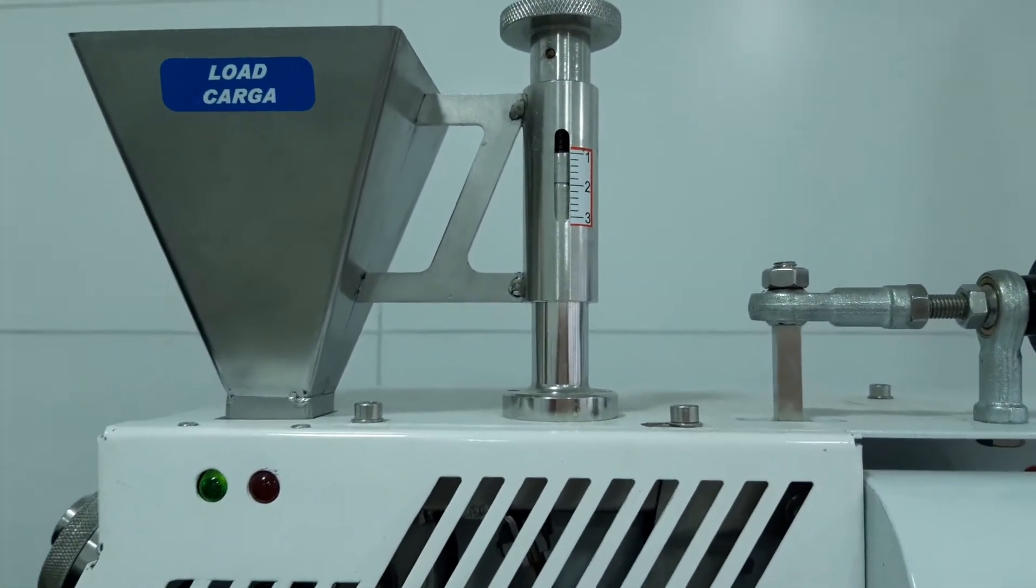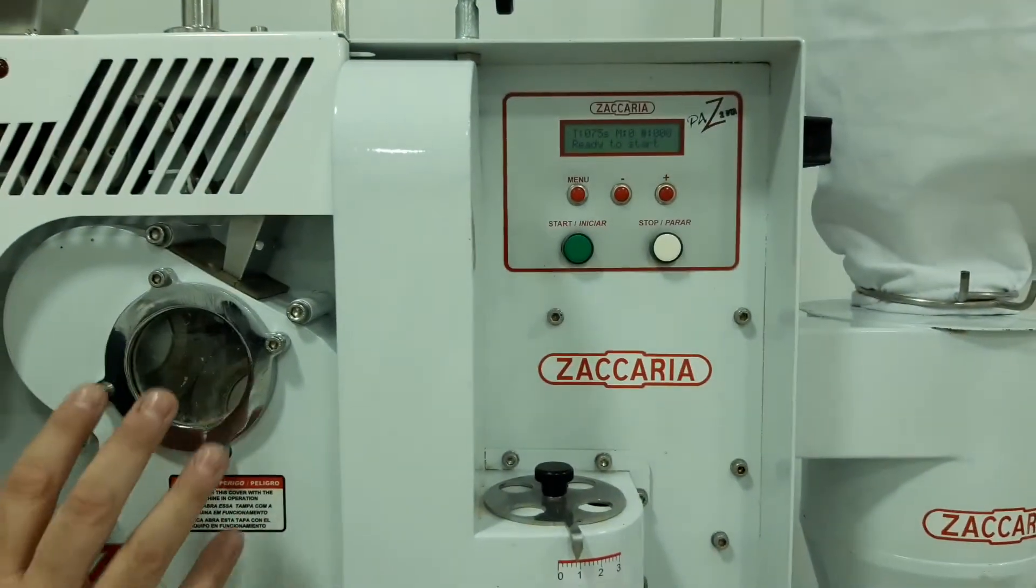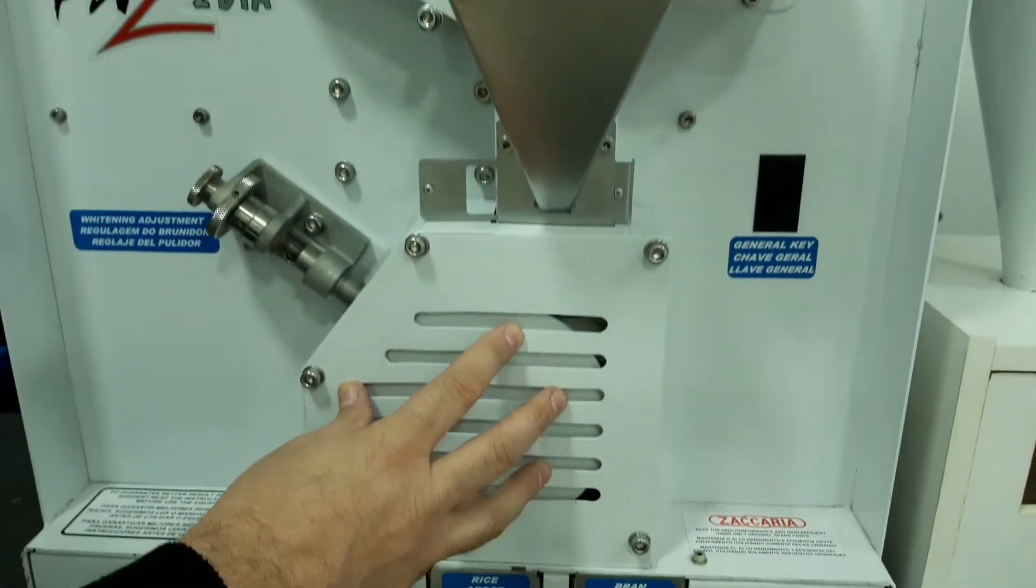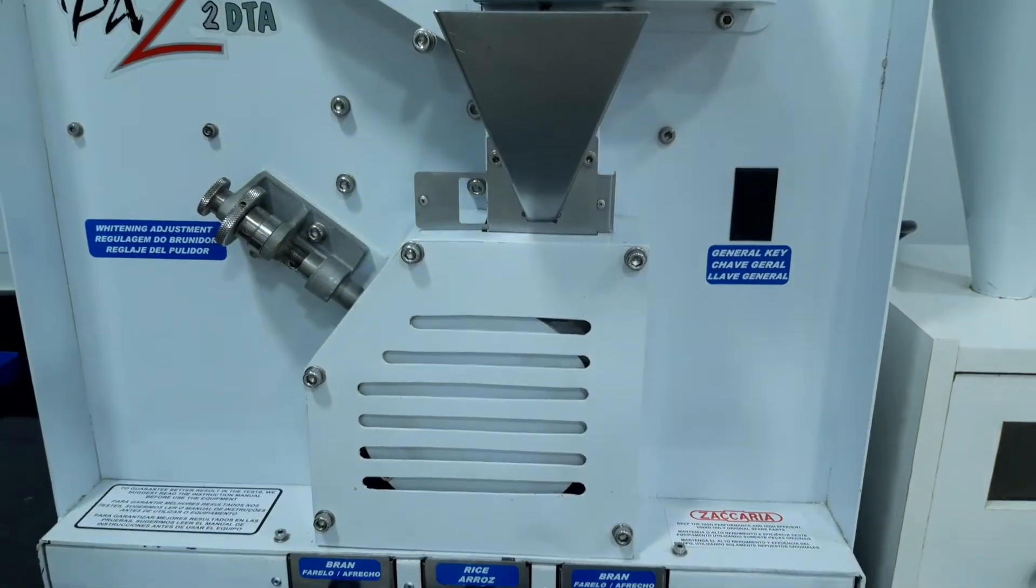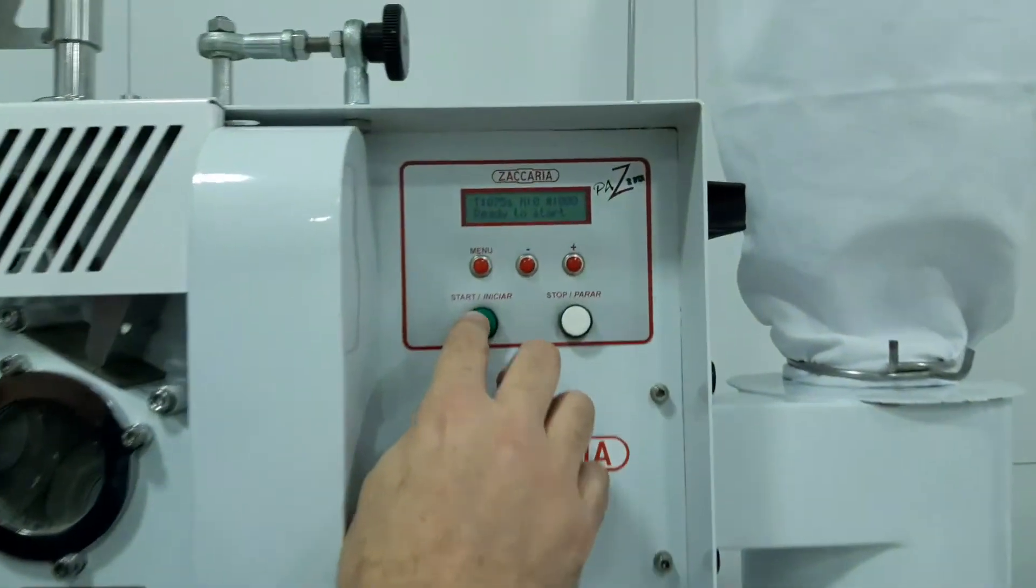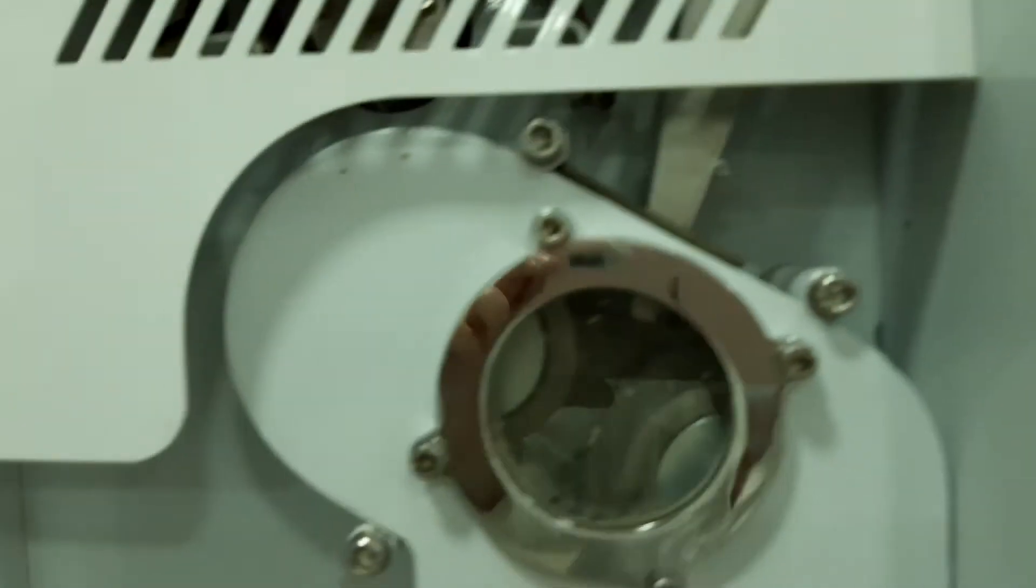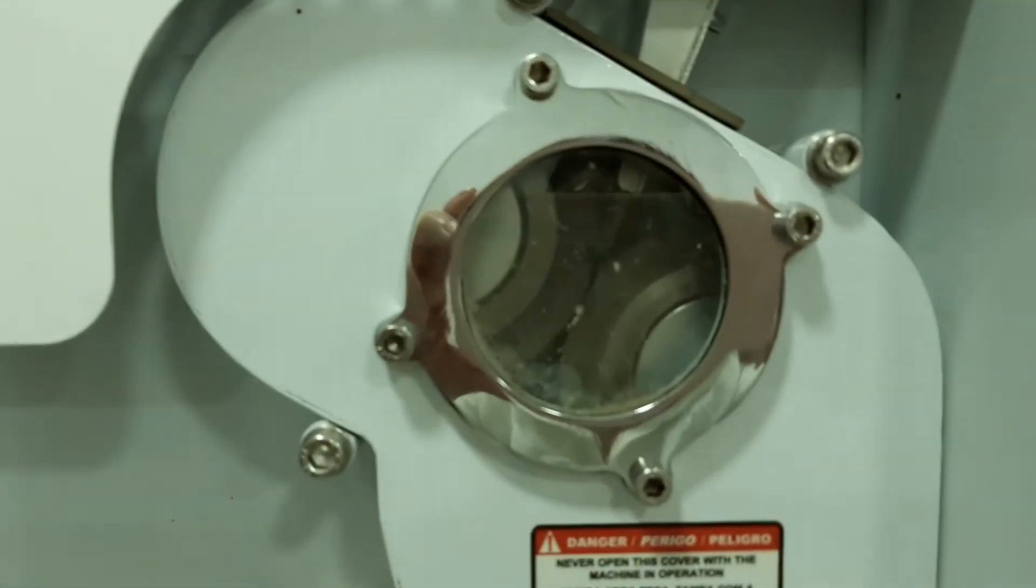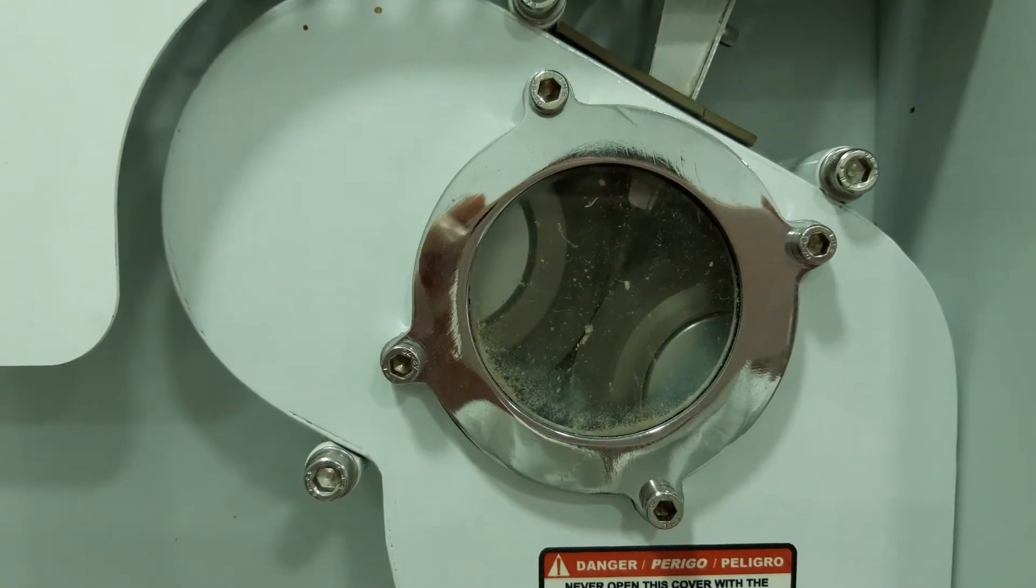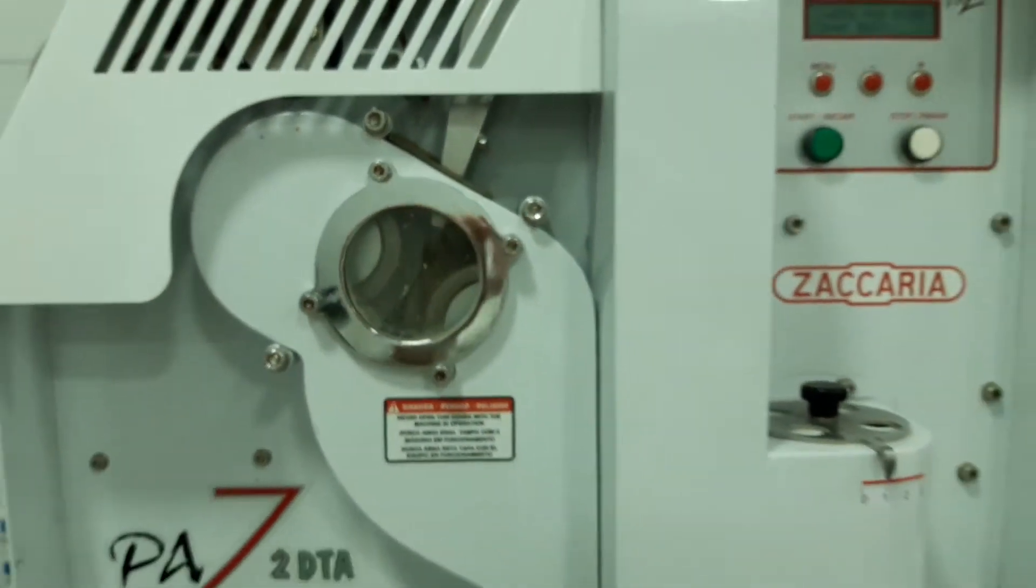And now we will start the process, the test. 15 seconds to husk, 60 seconds to whitening. And then the machine will discharge by itself and finish the process.